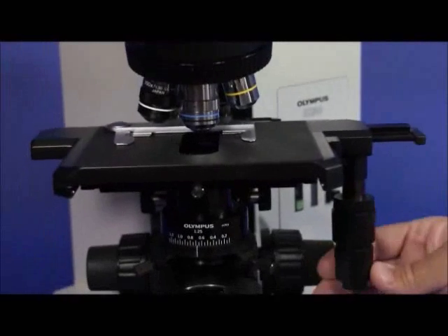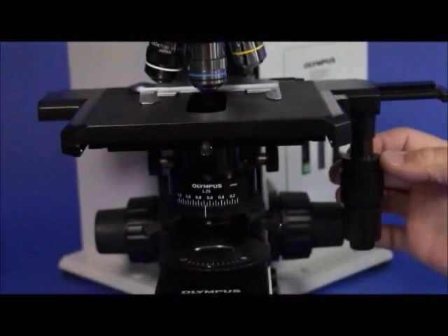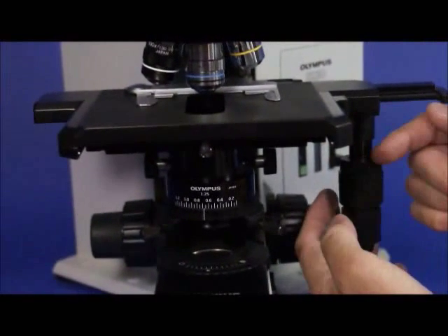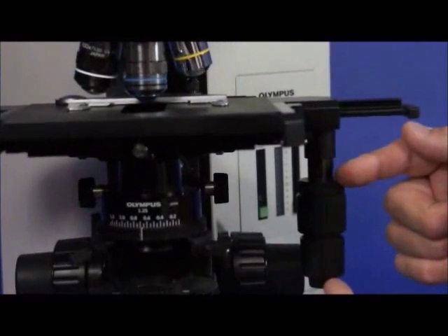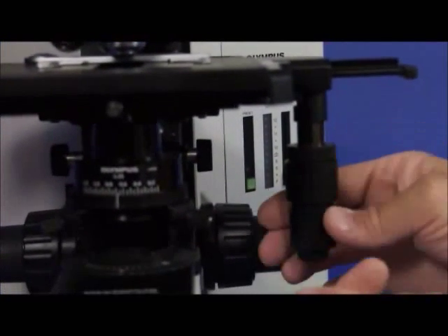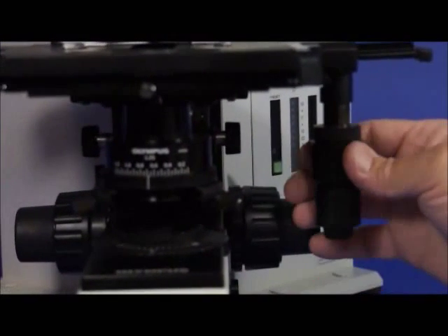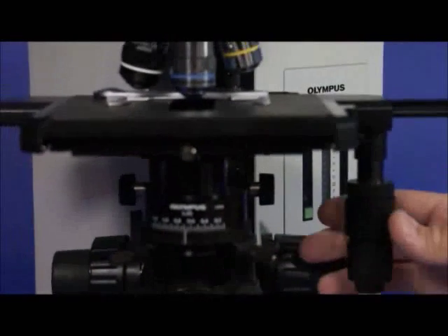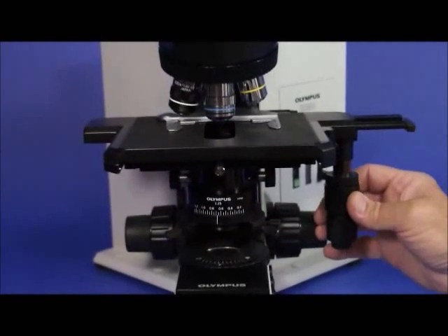The controls for the low position coaxial mechanical stage are also self-tension adjustable. This top and bottom knurled ring apply tension or loosen the tension in the XY drive. So you can make it as loose as you want for speed or slower for concentration on smaller precise areas of your specimen detail.